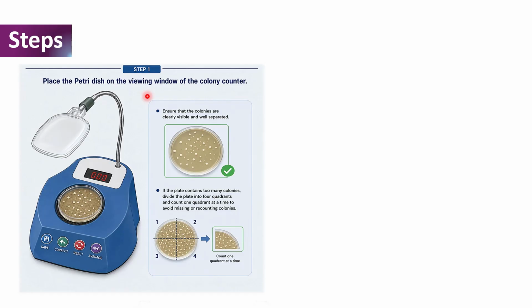So the first step involved in counting bacterial colonies on an agar plate is to place the Petri dish containing the colonies on the viewing window of the colony counter as shown over here. And in doing this, we must always ensure that the colonies are clearly visible and well separated.